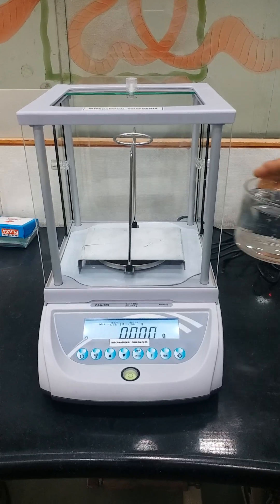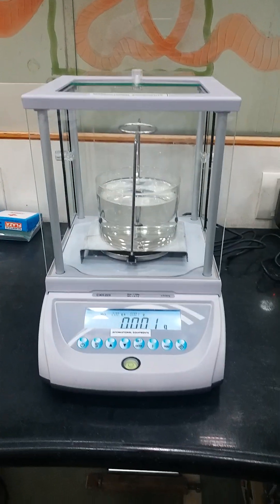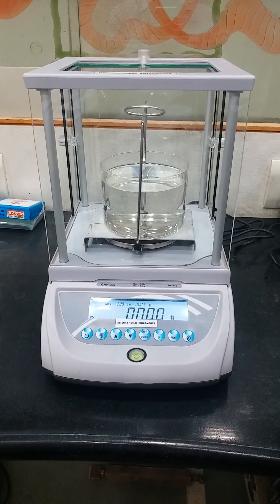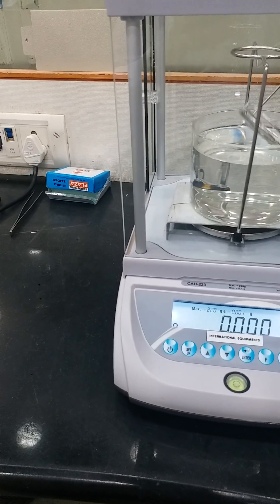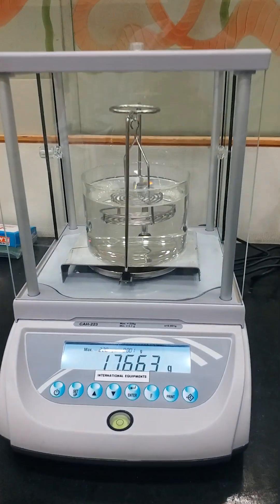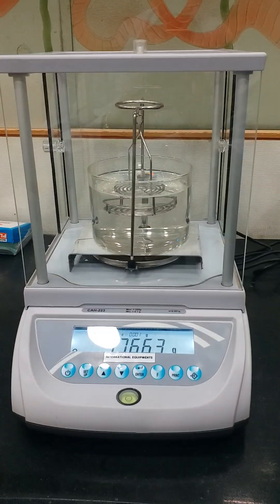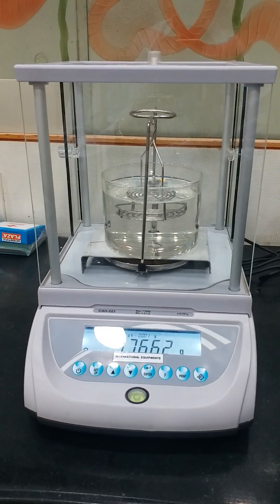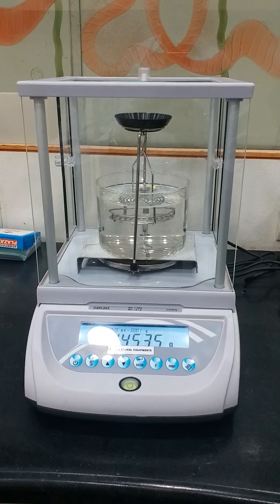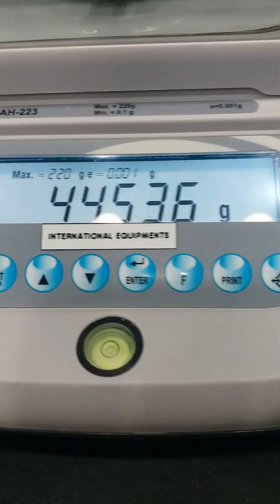Now put the beaker filled with acetone inside, on the top of the plate — it is freely suspended on top. The load should not come on the top of the pan, otherwise the pan will be damaged. Now put the floating tray inside. As you can see, the floating tray is fully immersed inside the liquid — this is very important. Put the black cap on the top of the encircled fixture. This is how we have done the mounting arrangement.